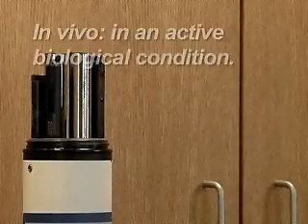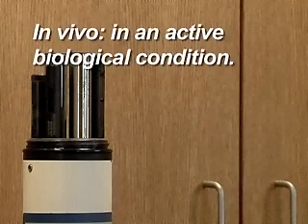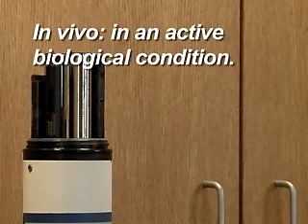Monitoring in vivo, that is, an active biological condition, is subject to a great deal of variability.